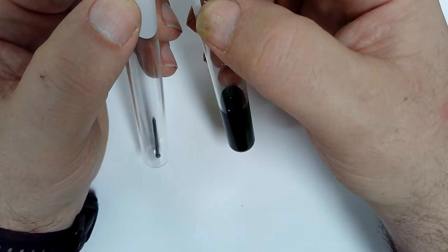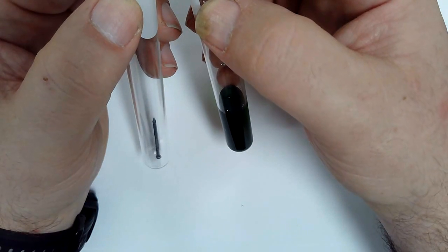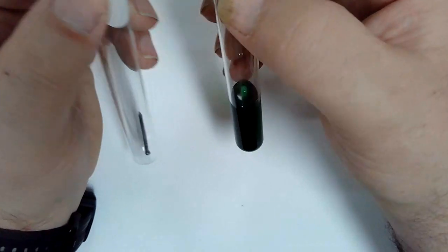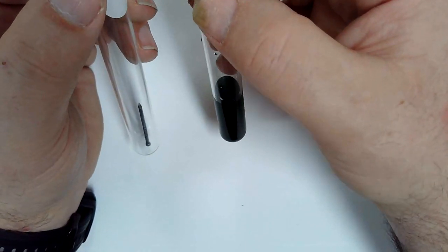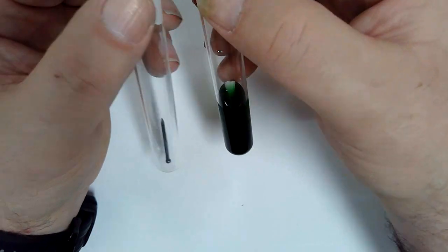By removing the product from the surface area and flushing clean solvent over it, the reaction will occur faster. So anytime I agitate this and knock some of that product off, I bring the solvent over the metal. It'll cause it to react faster again.